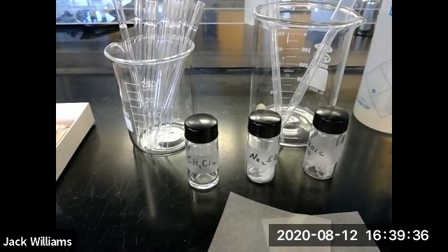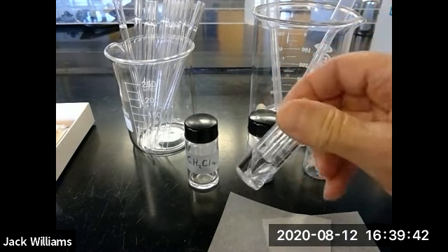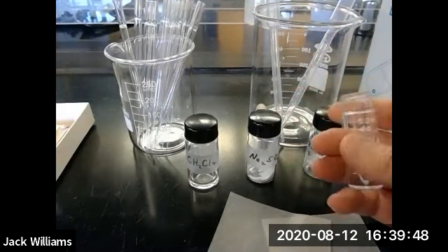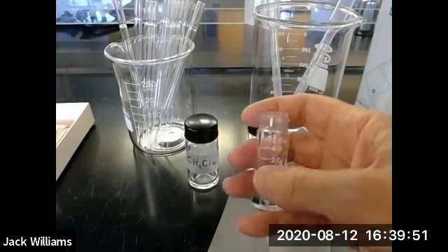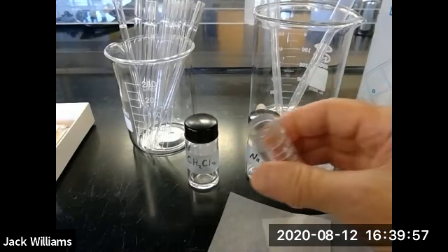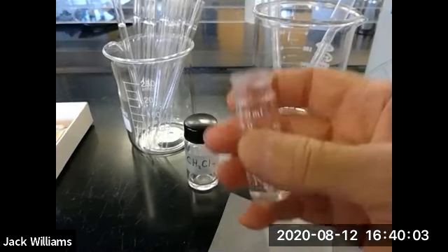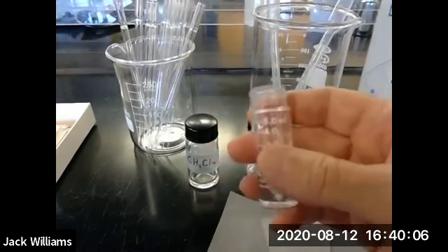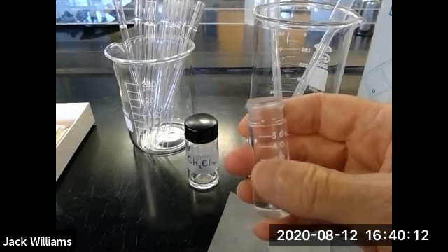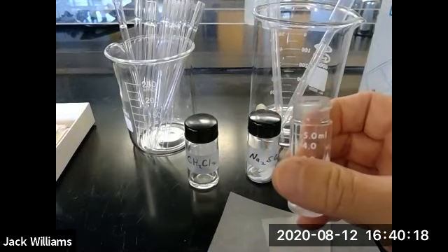Okay, so now let's take a look at what a conical vial is. There's a conical vial. We're going to use this to hold methylene dichloride, the benzoic acid, and water. And these are marked. Sometimes the marking gets worn away, but this is a 5 ml. It may not say 5 ml on there, but you only have two sizes in your desk drawer. Every student has their own desk drawer underneath the fume hood, and those are color coded. So if you were in the lab for Monday, it'll be a red stripe in there. Tuesday will be a different color. If you're in the afternoon, if you're in group B, then it'll be 2 stripes instead of 1. And this will be on your experiment.